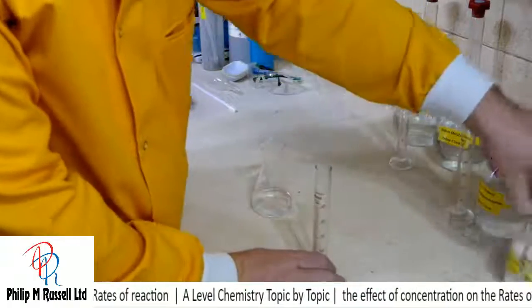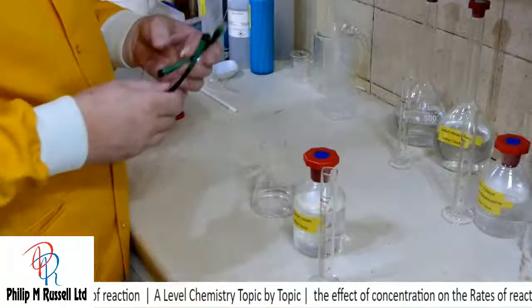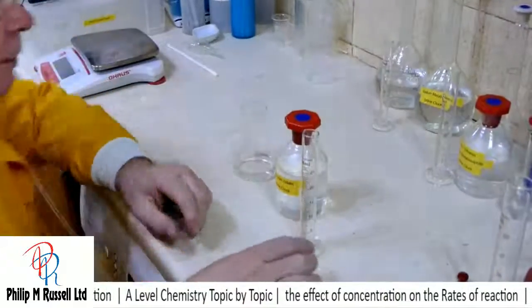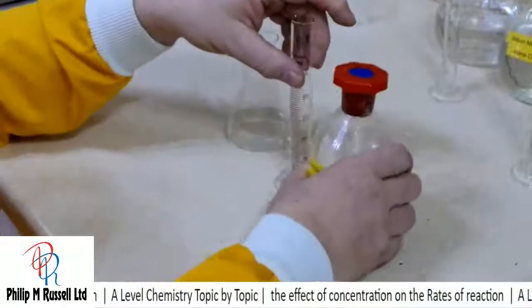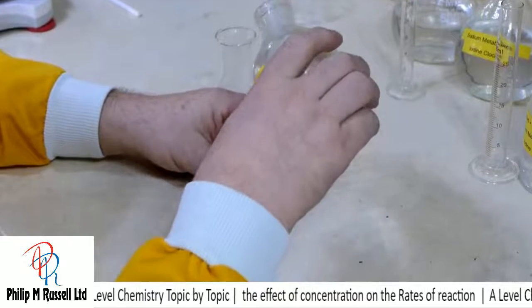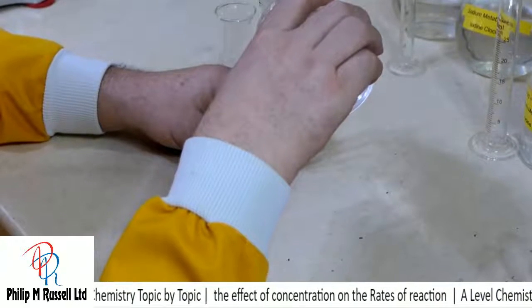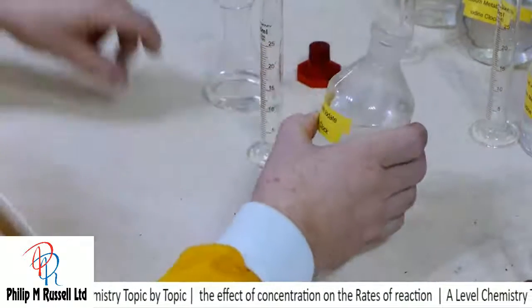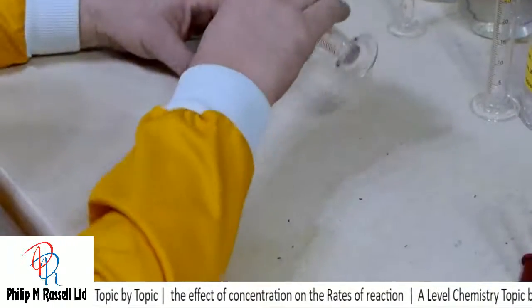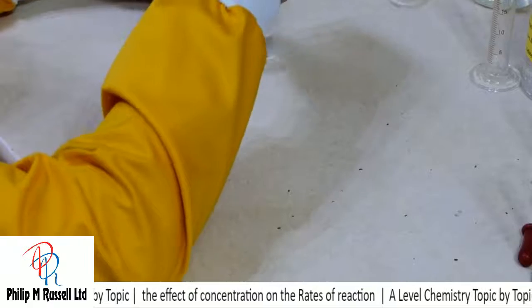And what I'm going to do is I'm going to take some potassium iodate and I'm going to put that in. Right, we're going to get a little bit more involved with chemicals now, so let's take 10 mils of this. So this is the potassium iodate solution. It's about 0.02 molar. So it's quite dilute, and I'm going to add that to the water and give it a good mix.